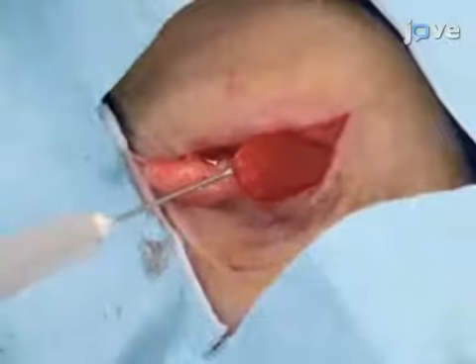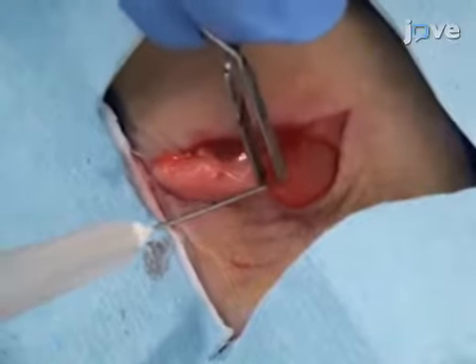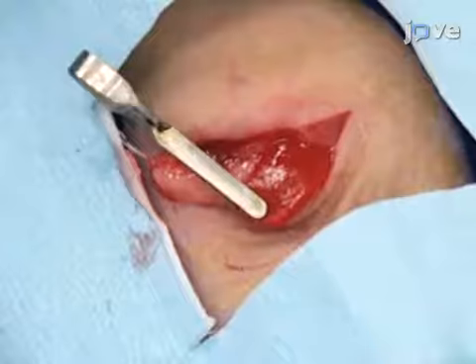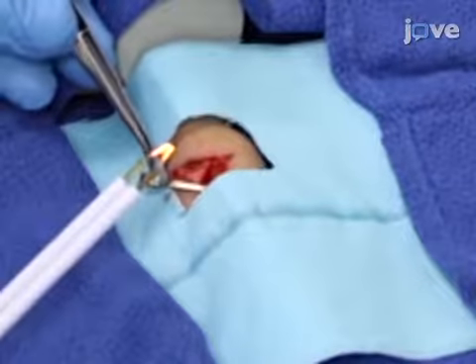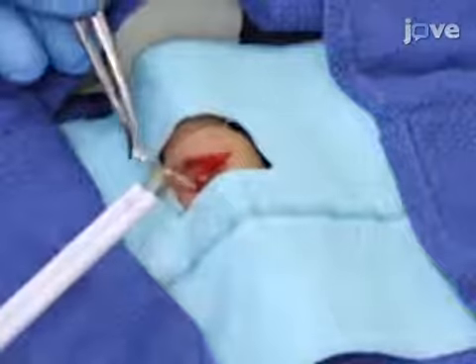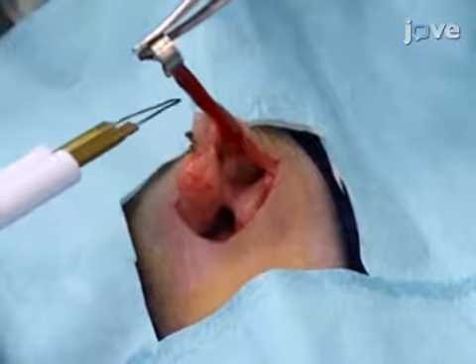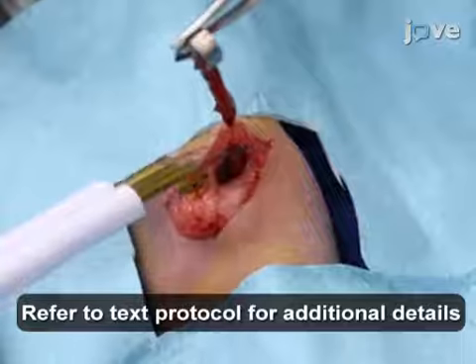At the end of the injection, place a microclip on the spleen prior to removing the needle to prevent leakage of the injected cell suspension, and leave it in place for 5 minutes. 5 minutes post-injection, use a handheld cautery device to perform a splenectomy for hemostasis. Begin with the splenic hilum on the anterior side by pre-coagulating the proximal side of the vessels with adjacent fat tissue.